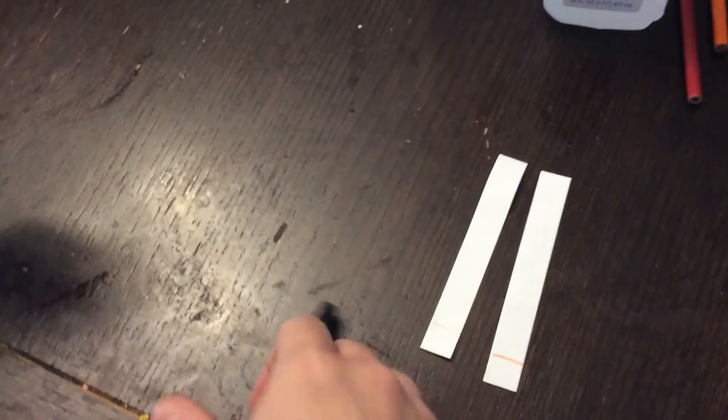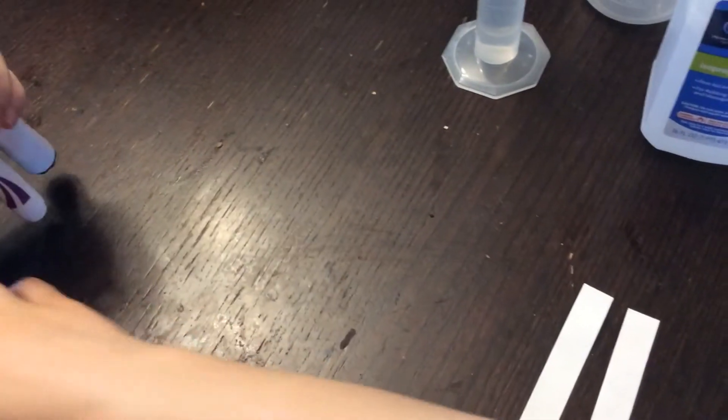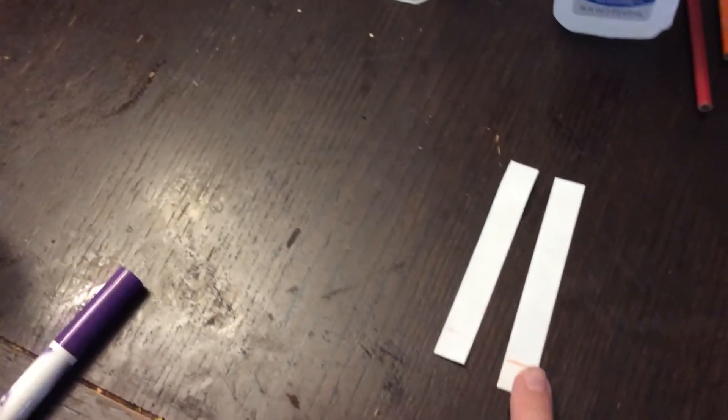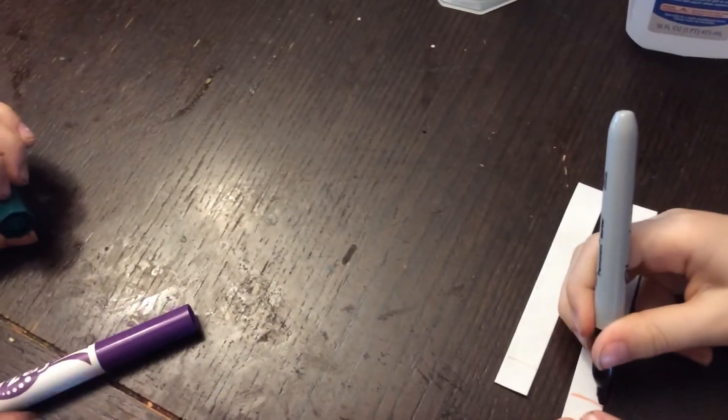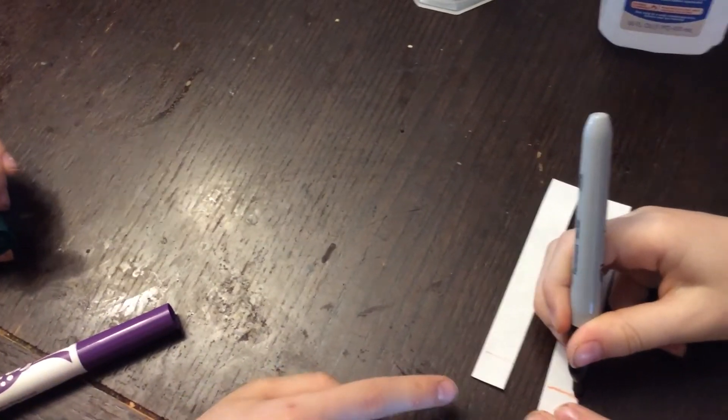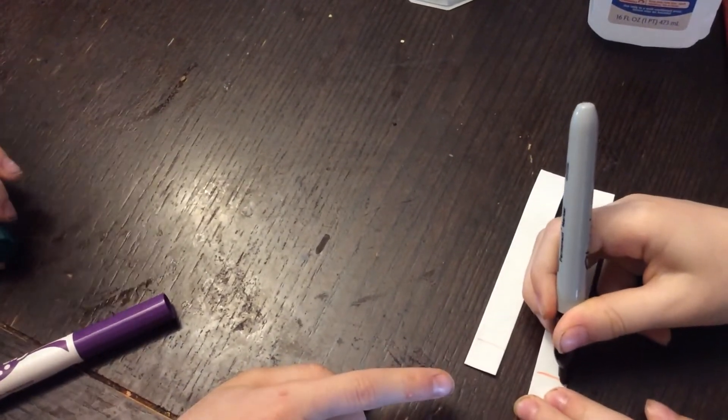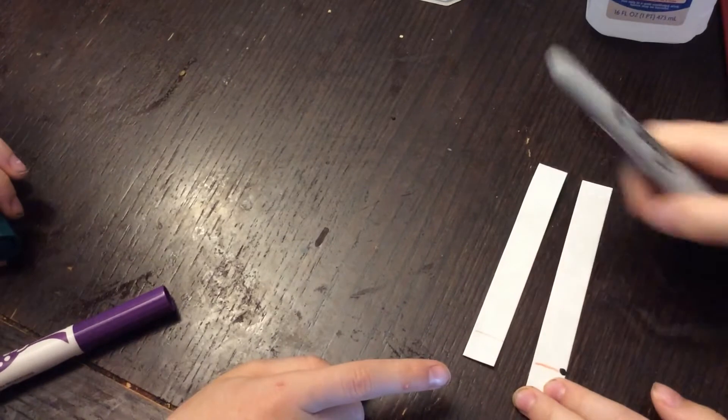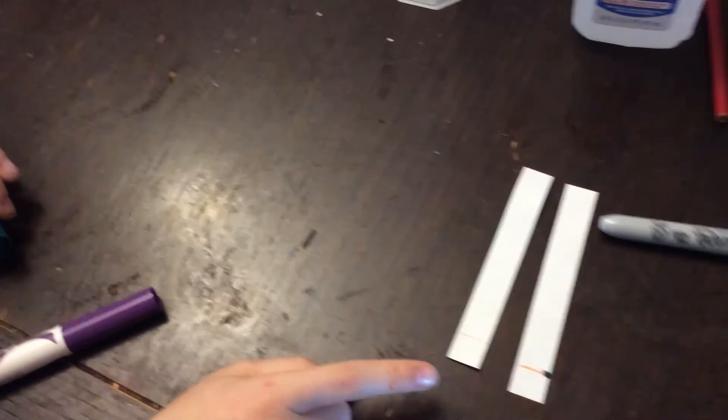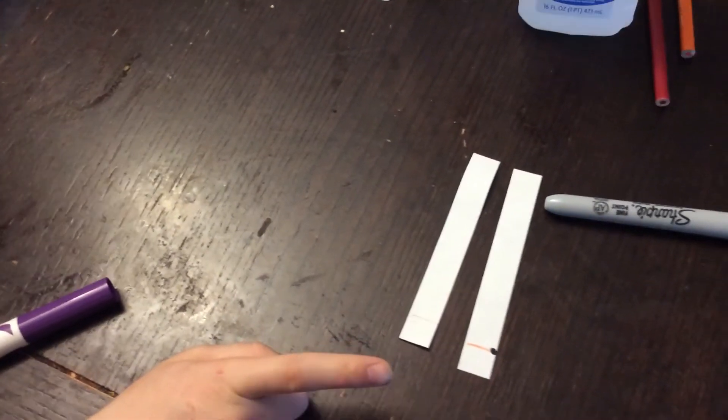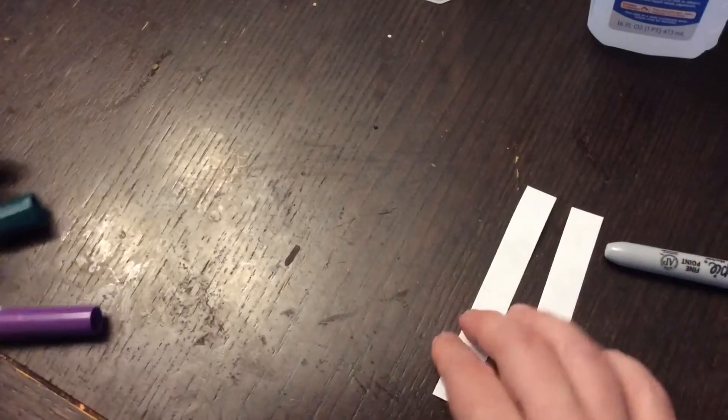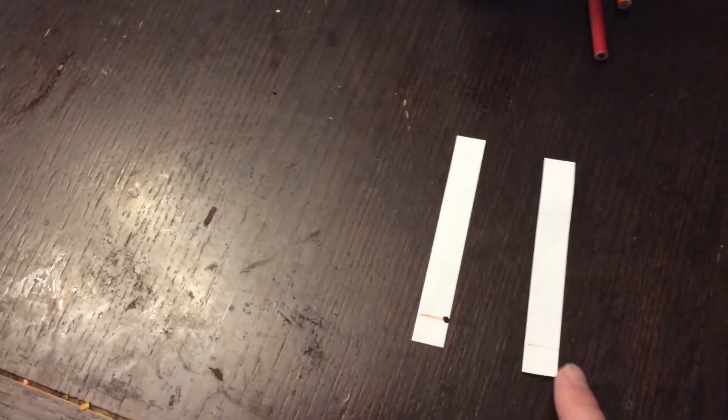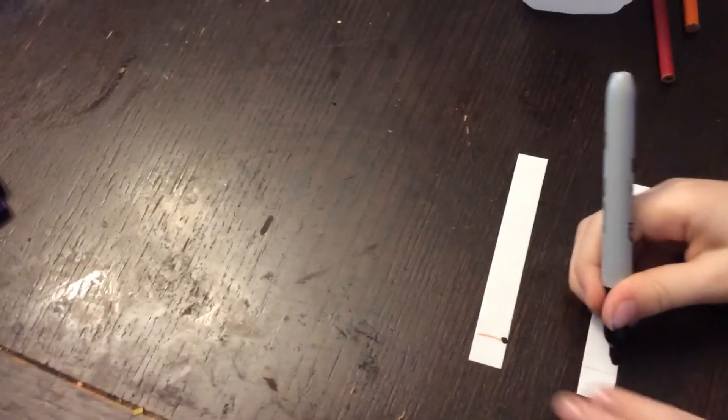Okay, so scientist number one, I want you to make your marker on the very edge right there. And this is not ordinary paper, this is chromatography paper. Okay, now make your first dot in the same spot on that line.